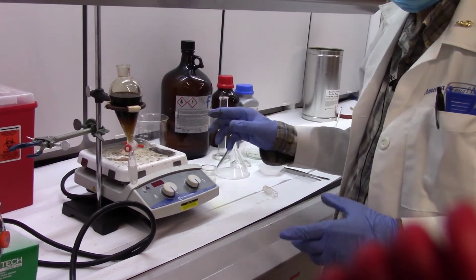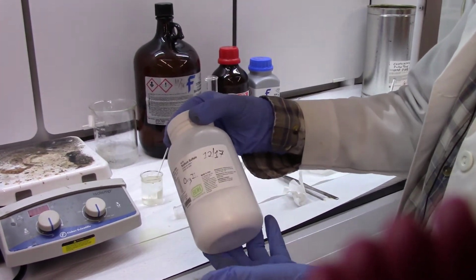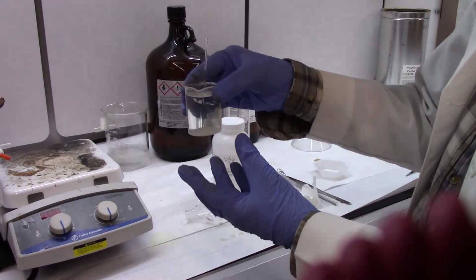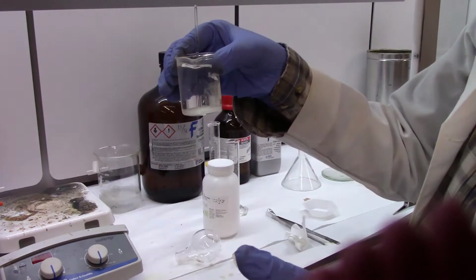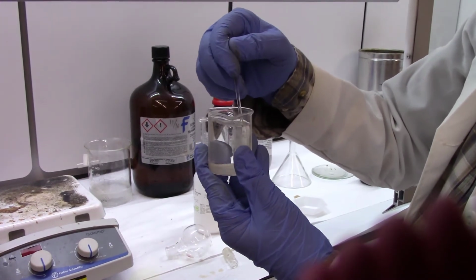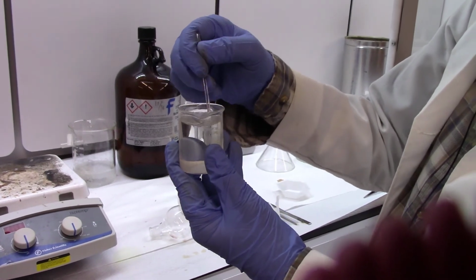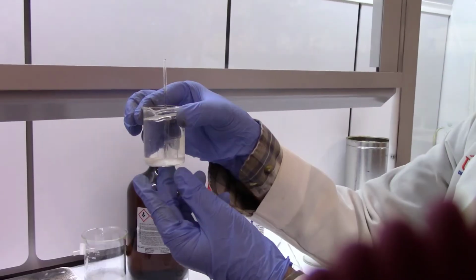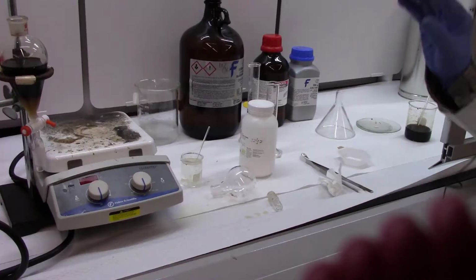There might be some moisture in there too, and we will get rid of it by adding anhydrous sodium sulfate to it. Okay, now we add anhydrous sodium sulfate, and we leave the DCM extract over the sodium sulfate for about 5 to 10 minutes, or you can speed up the drying process. Anhydrous sodium sulfate removes moisture from the DCM, and that's what we are doing. So now you see the DCM layer is quite clear, and that's good. Now we can evaporate DCM from it.